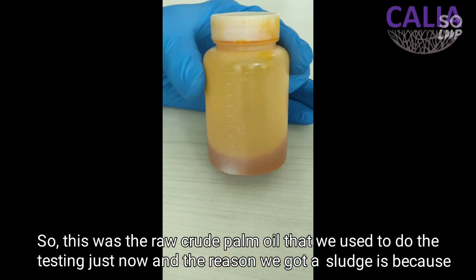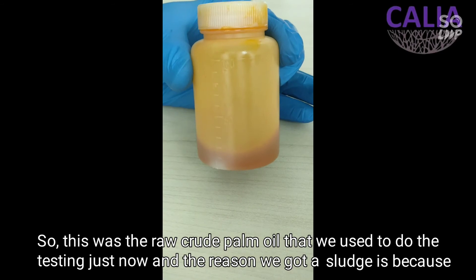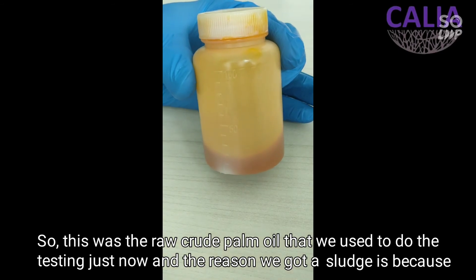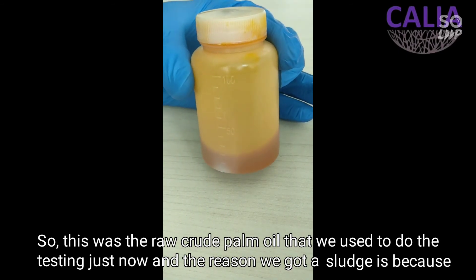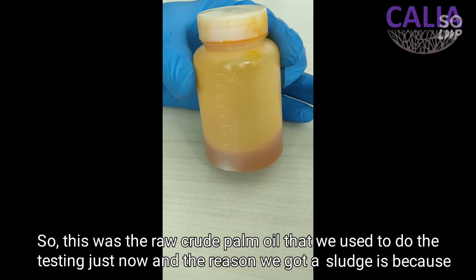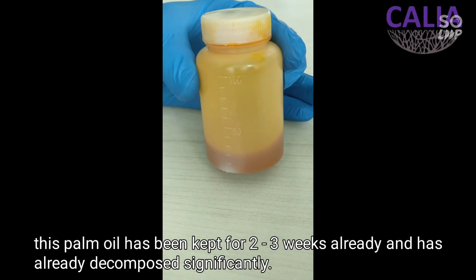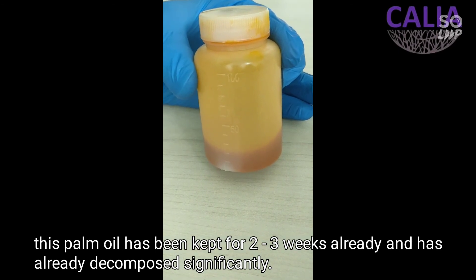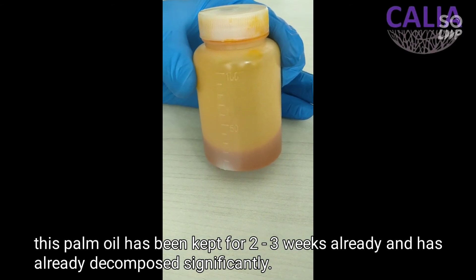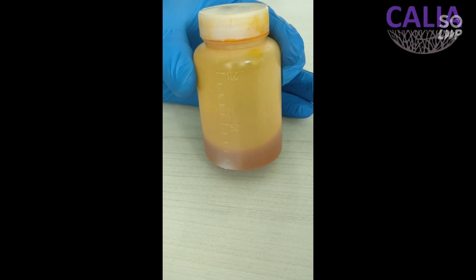So this was the raw crude palm oil sample that we used to do the testing just now. The reason we got a sludge grade is because this palm oil has been kept for 2 to 3 weeks already and has already decomposed significantly.